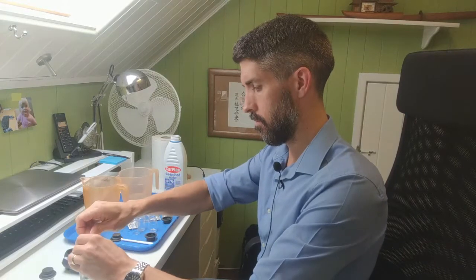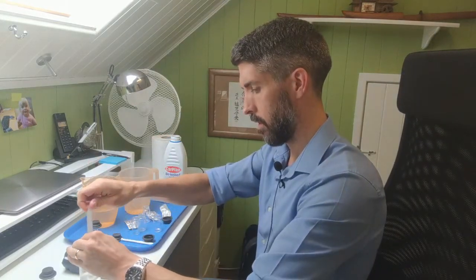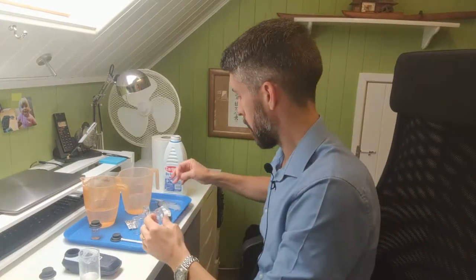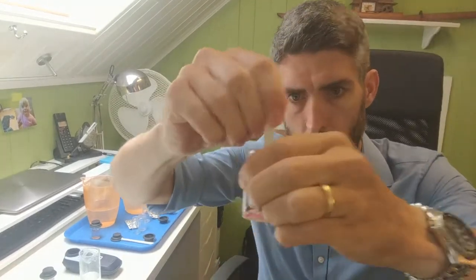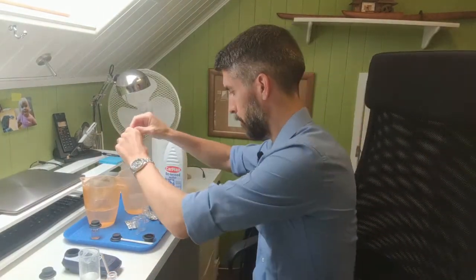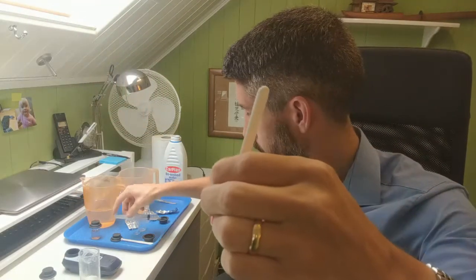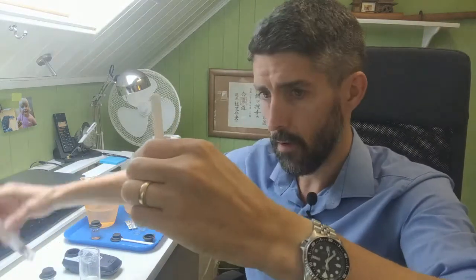So what we're going to do is draw off a sample of the diluted water and rinse out a test tube a couple of times, and again just leave a few drops of water there. Put a DPD1 tablet in and crush that. Observe the colour of the water with the tablet in, it goes a pink colour, and then top that up to the 10 ml mark with the diluted sample. Again, observe the colour.